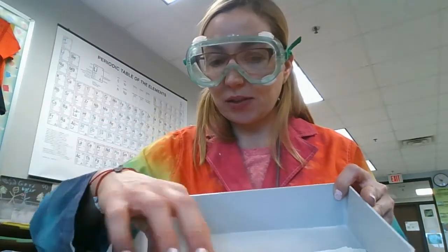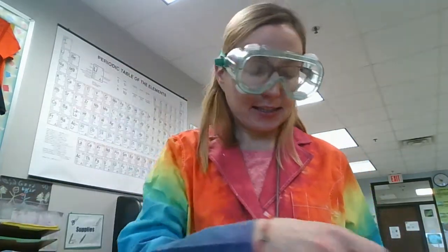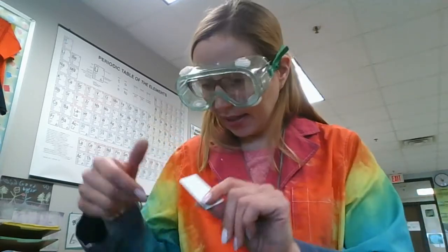Treat your TLC plates really carefully. You'll also find these capillary tubes that we were just using. So grab out two TLC plates, that's what you will need, and one of these triangles of filter paper.